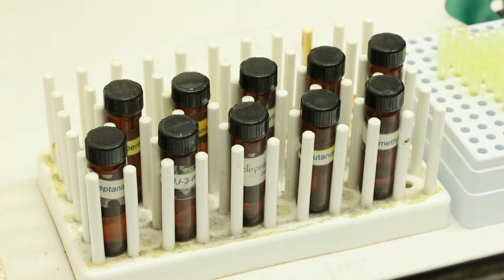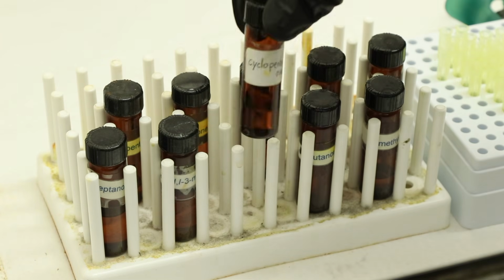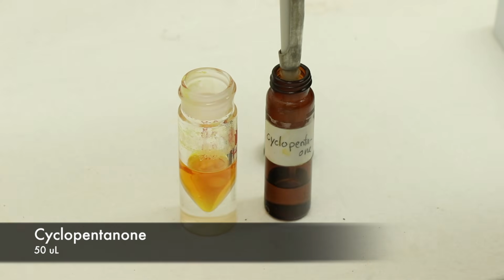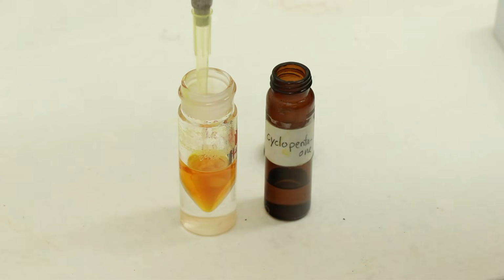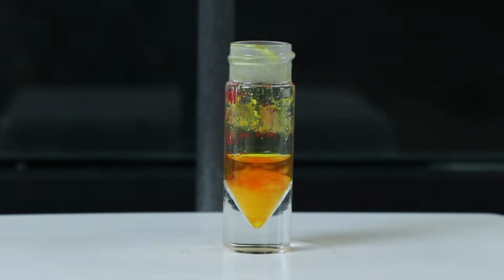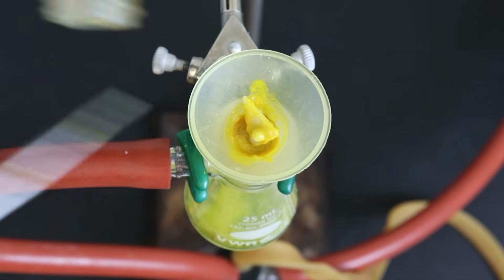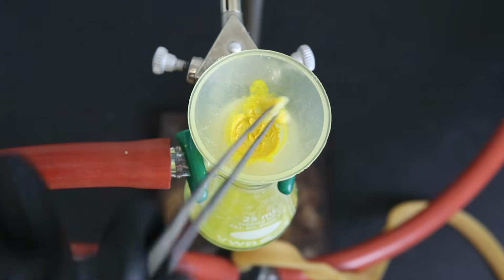Then over in the hood, the standards for the 10 different ketones will be provided. So I'll find the one labeled as cyclopentanone and transfer 50 microliters over to the hydrazine solution. I'll let that react for a few minutes at room temperature again, and then remove the derivative from the solution following the same exact technique as before, rinsing it with some sodium bicarb and some distilled water.